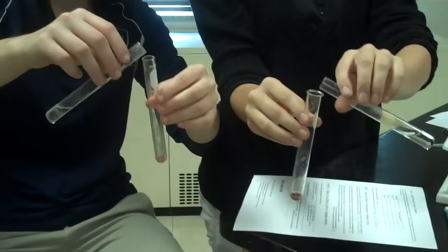So, we basically warmed both and we cooled both. So, we're going to combine them together at the same time so that we can compare. Okay, wait, wait. Okay, ready? Go.